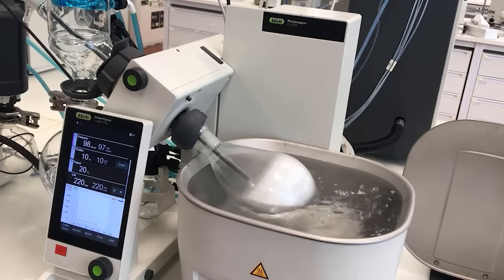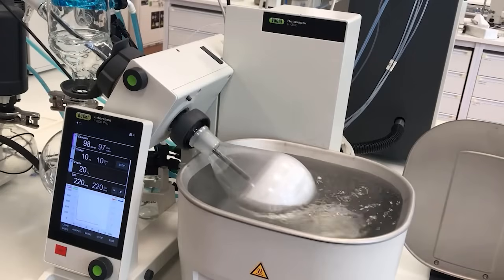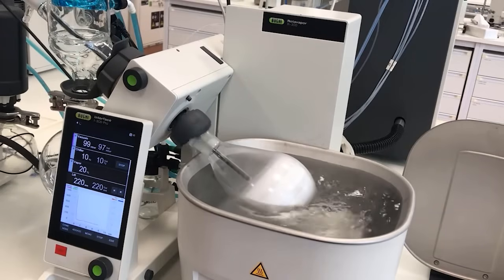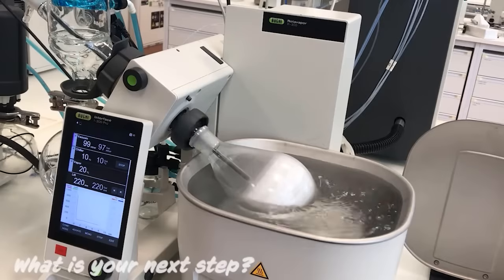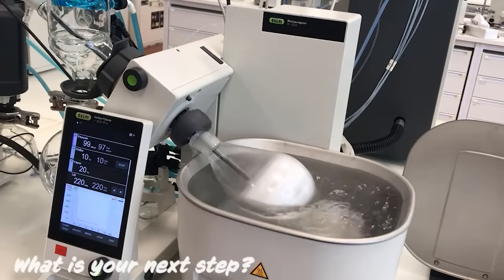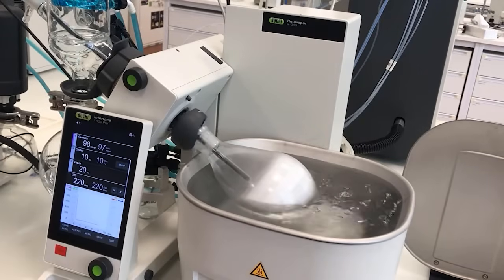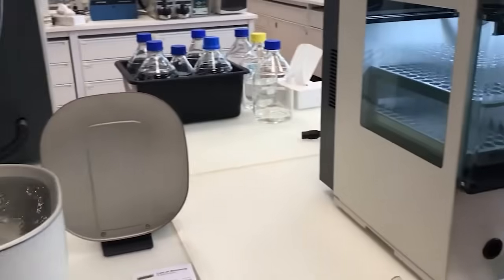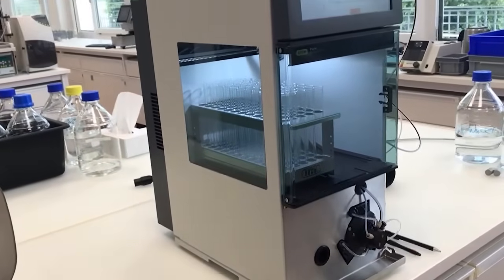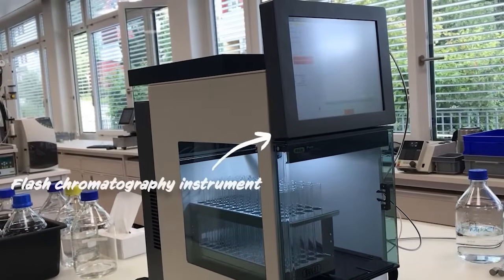In order to decide whether you should go for concentration or drying, you need to know what your next step is. For example, if you need to do a purification with a liquid injection of your sample into the chromatography system, then you would need to perform a concentration.